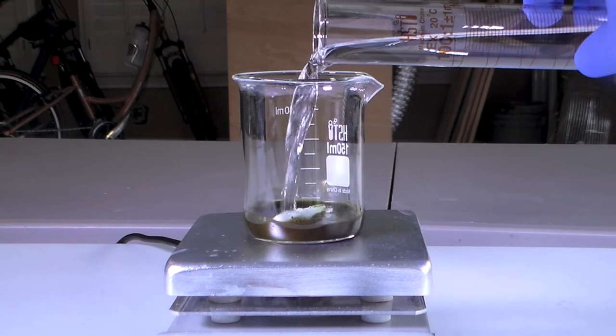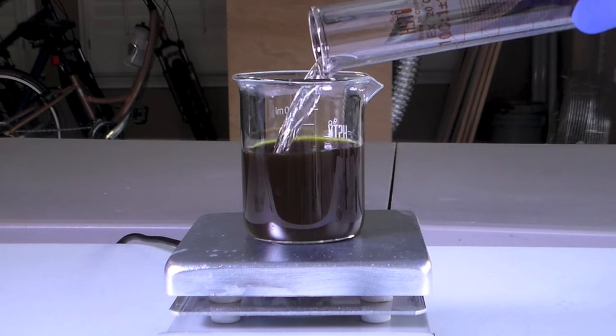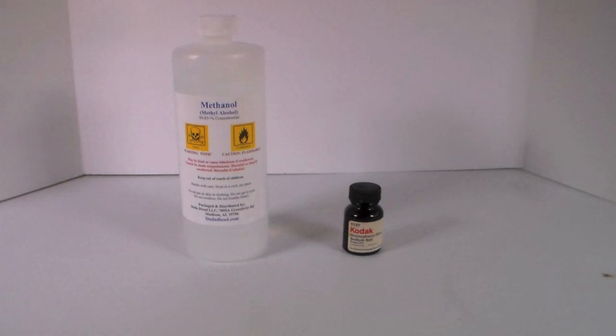Making a bromophenol blue solution is very easy and only takes a few minutes. All you need is bromophenol blue powder and methanol.